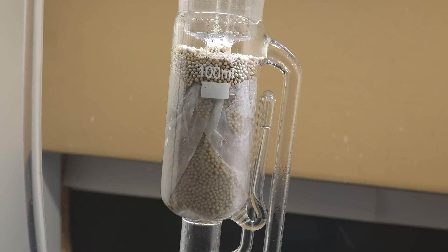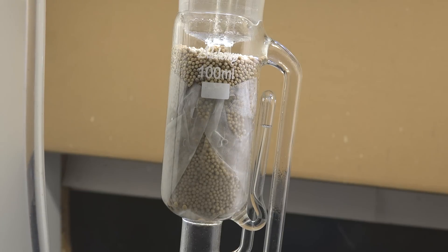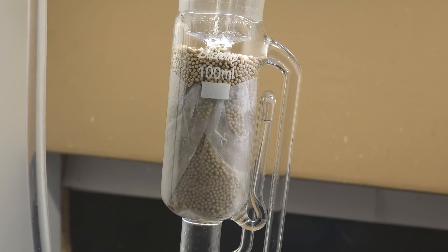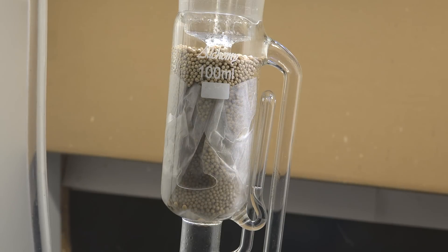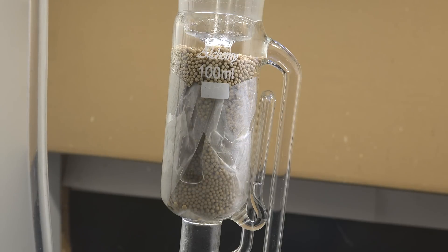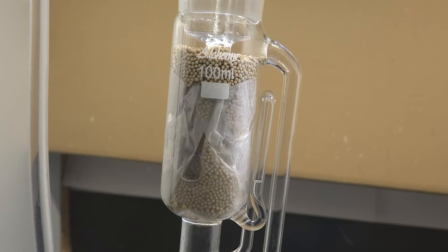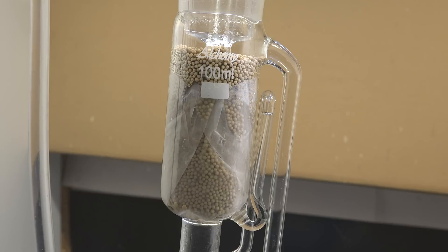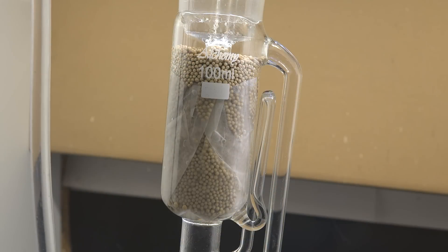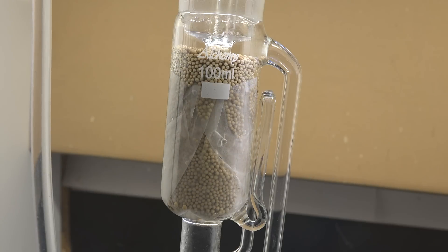For those who don't know, azeotropes are mixtures that boil together — they behave almost like pure chemicals in that they boil and condense with the same composition, and you can't separate them by distillation alone. I don't know exactly what azeotrope compositions form here; water and ethanol make one, but I've found no data on ethyl propionate azeotropes. Whatever it is, I'm betting the lowest-boiling azeotrope contains water. Even if it's just a few percent water, that's tremendously advantageous. Molecular sieves are extremely good at extracting water from organic solvents, so any ethanol or ethyl propionate that condensed would be thoroughly dried and returned to the boiling flask, where it reboils along with more water. By cycling the water, alcohols, and esters around the extractor we can gradually remove all the water — and only the water — without losing our alcohols or esters as we would with straight distillation.